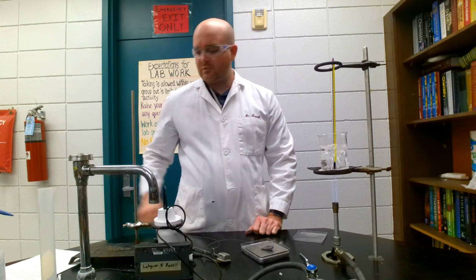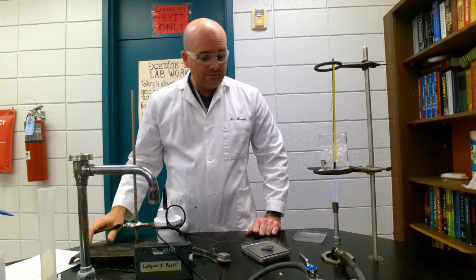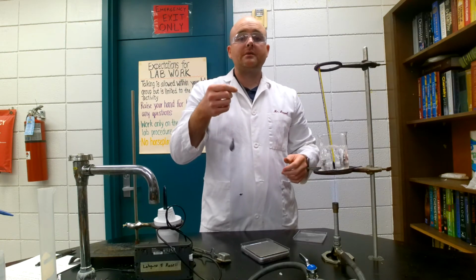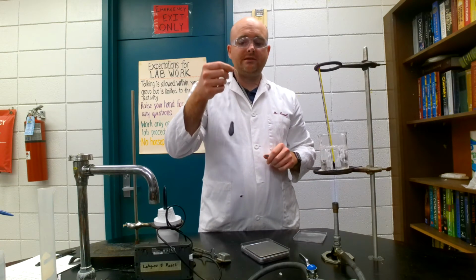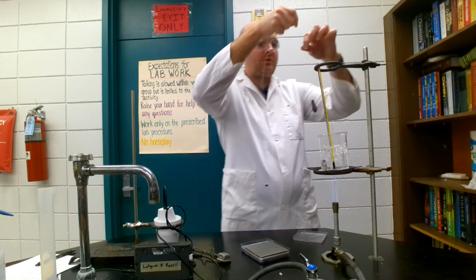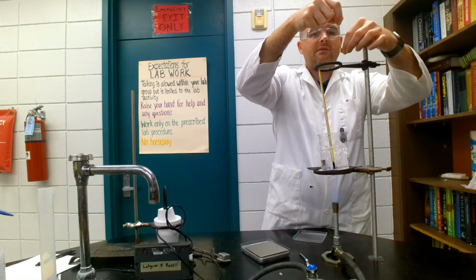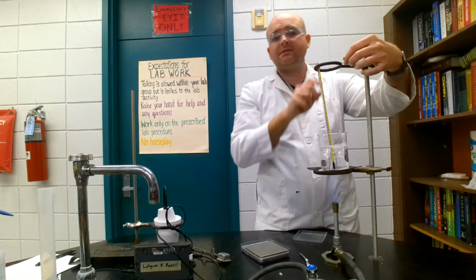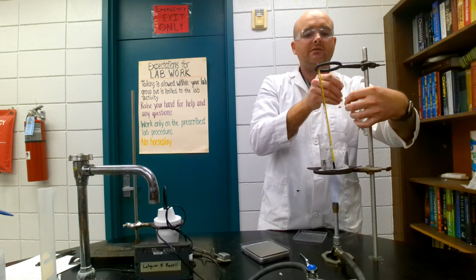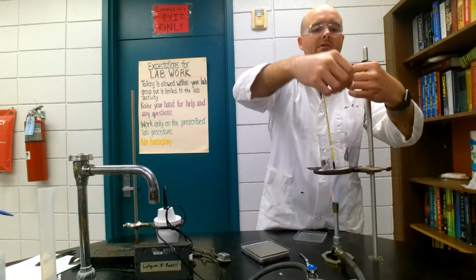Close enough for government work. So it is going to be 52.42 grams. So I'm going to take the lead, I'm going to heat it up to 100 degrees Celsius because this water is 100 degrees Celsius. It's boiling water with the Bunsen burner. So I'm going to tie it in here so that it's not touching the bottom, because it might get a little hotter than 100 degrees Celsius if it was touching the bottom.